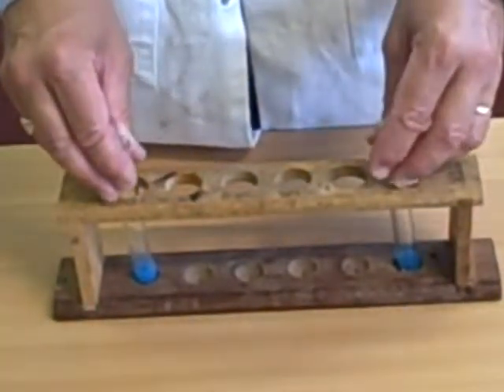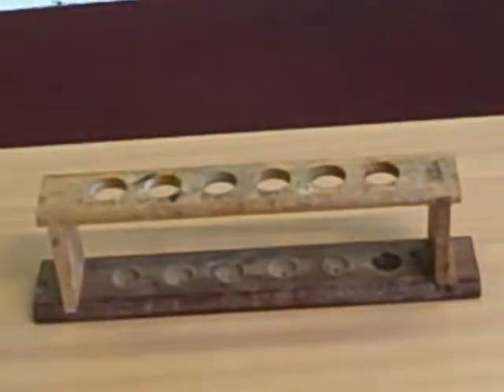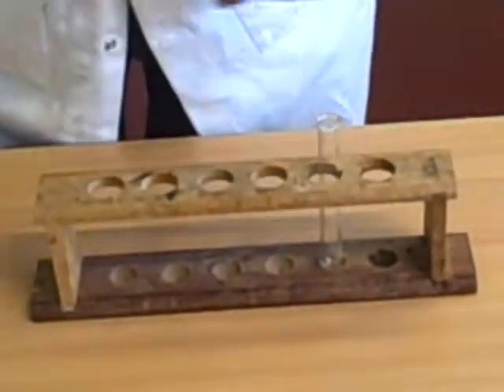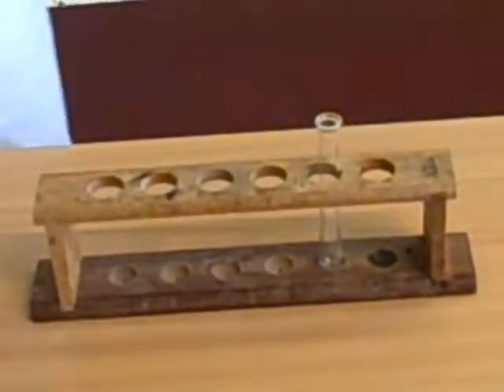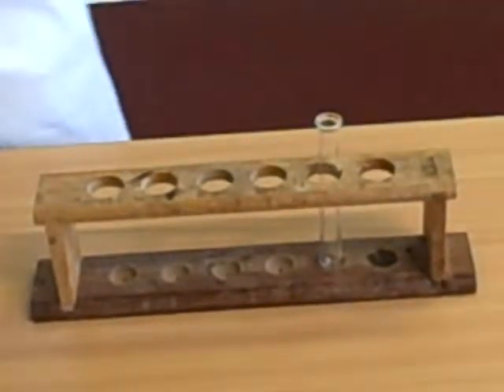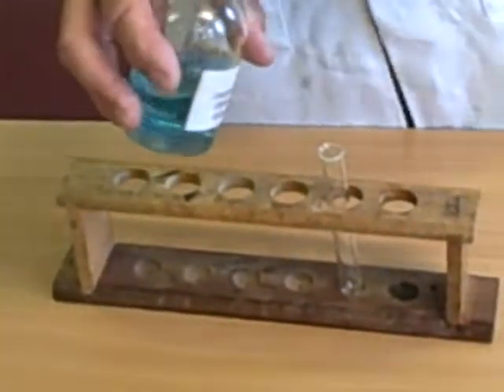The next experiment I'd like to do is taking a clean test tube, and instead of using sodium hydroxide and instead of using copper sulfate, we're going to see what happens when we put copper chloride.